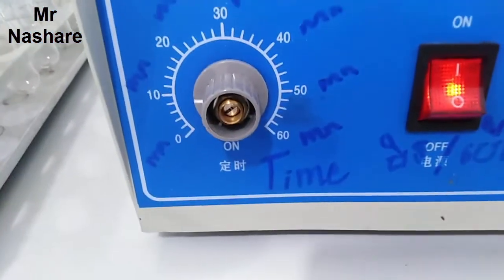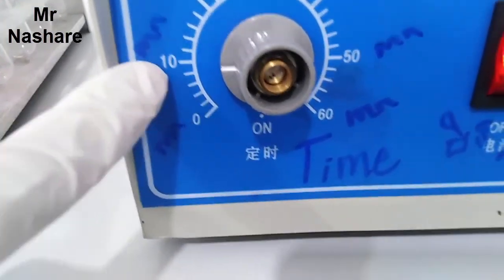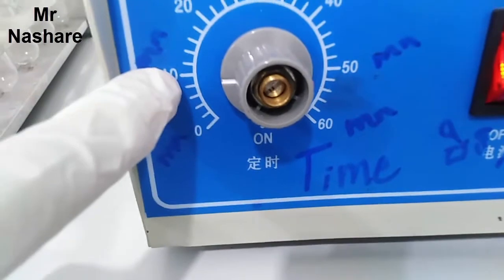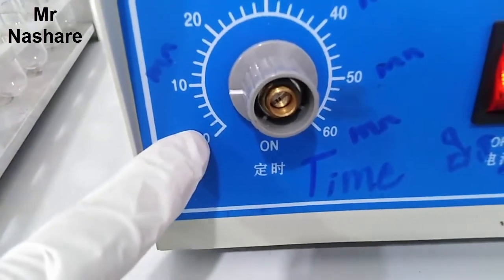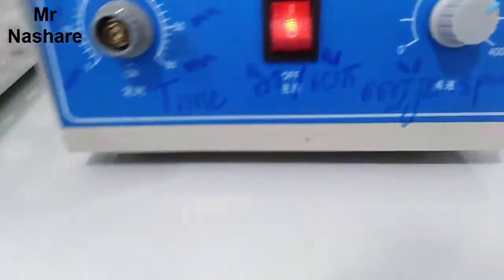The time of this machine will run for 10 minutes, and after that we roll it down from 10 to 0 and the machine will stop.